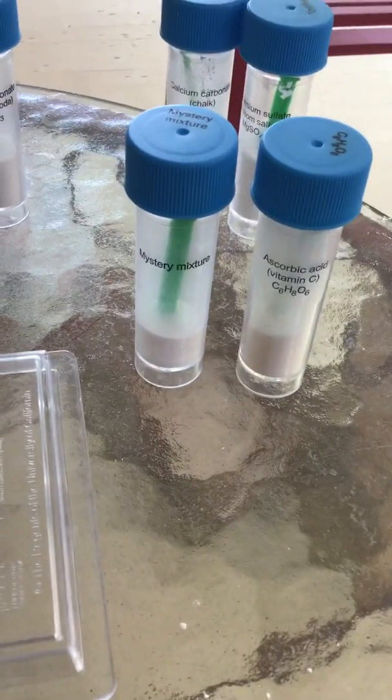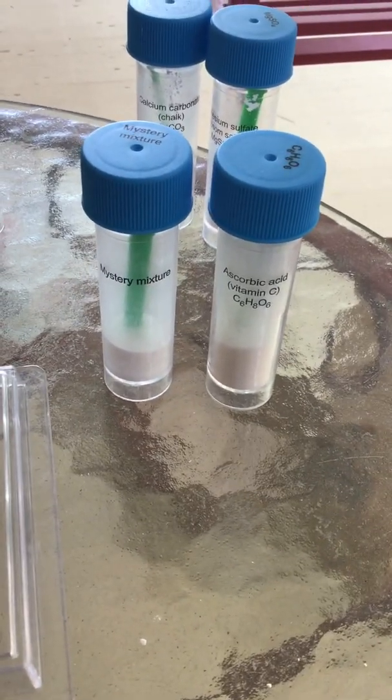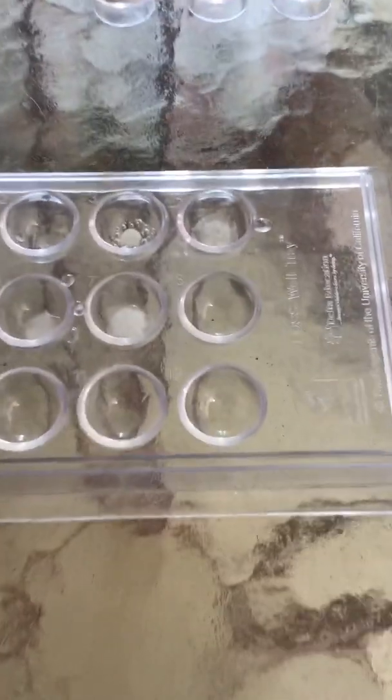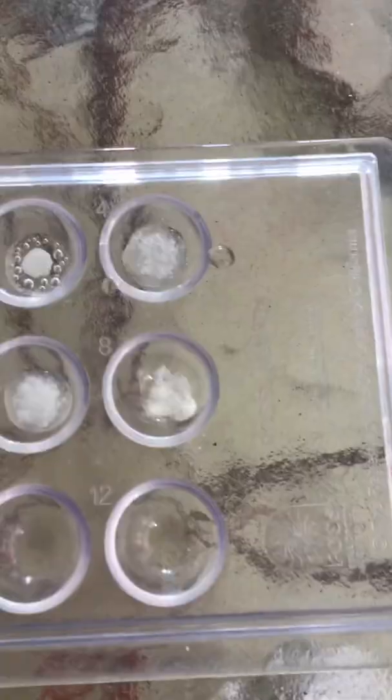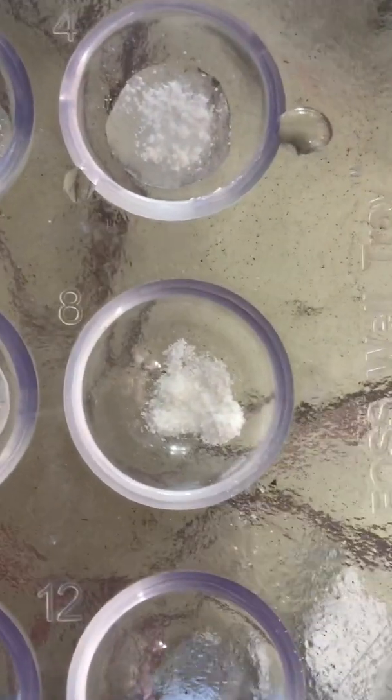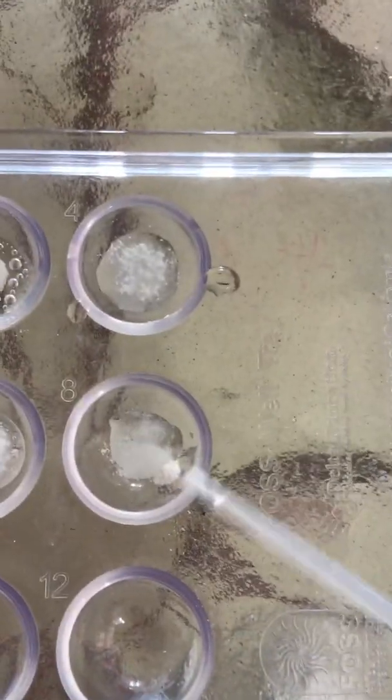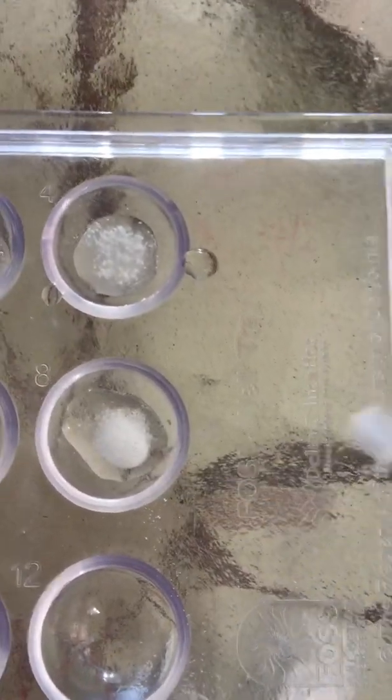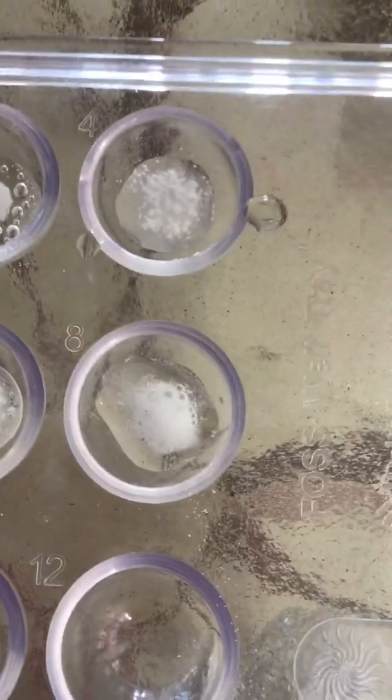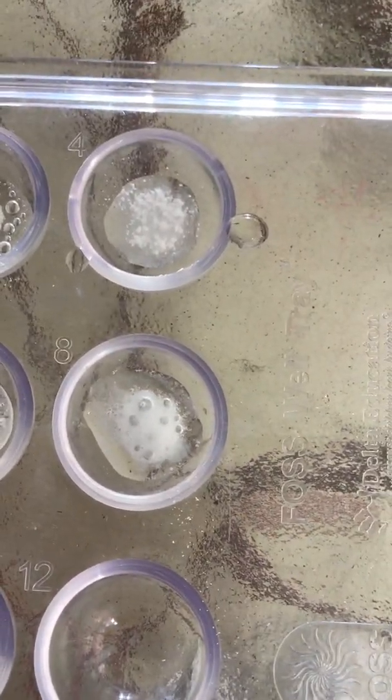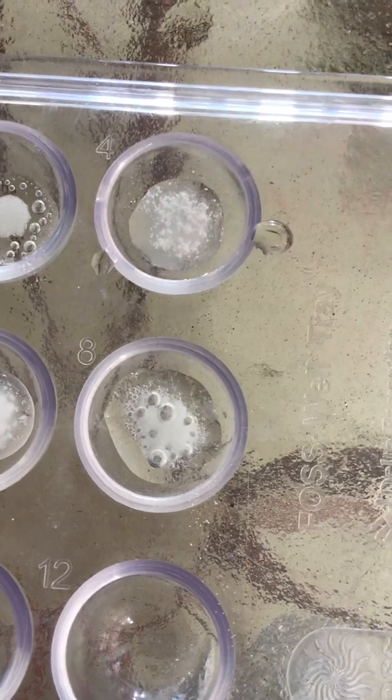Next, I'm going to mix the mystery mixture with ascorbic acid in well eight. Very grainy-like. Here's what happens when I add water. Definitely some fizzing. Seems very similar to the third one. Still seems more than just the mystery mixture by itself.